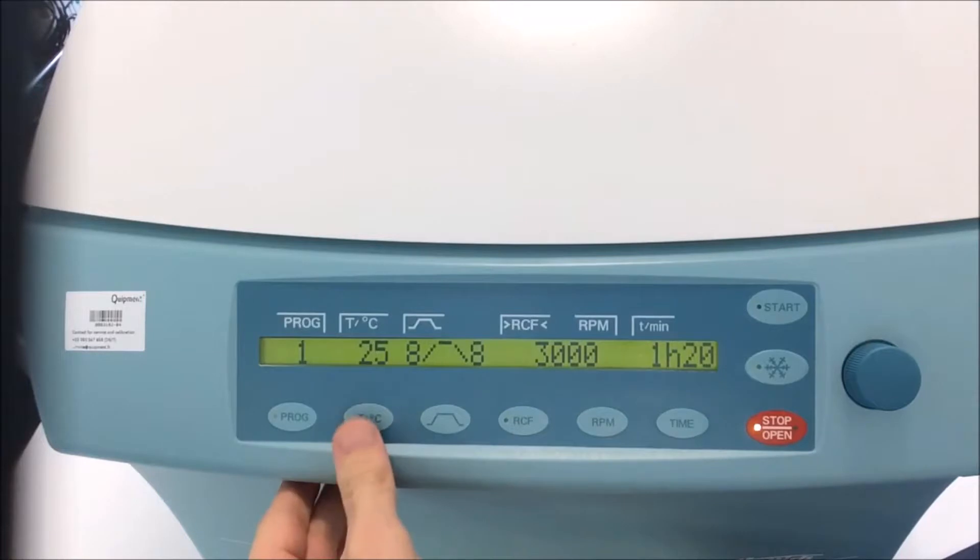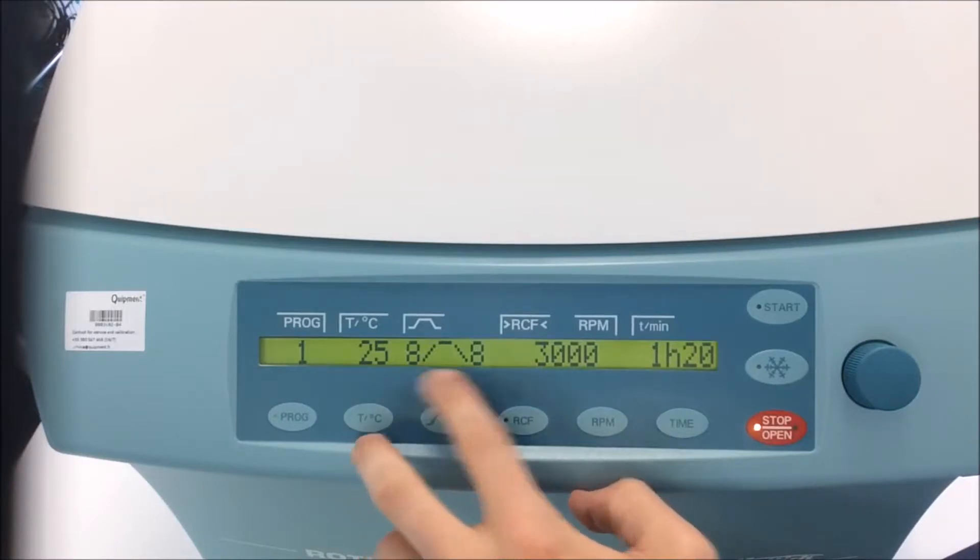We have a temperature defined to 25 degrees, and we have a start-up and run-down parameters defined to 8, both.